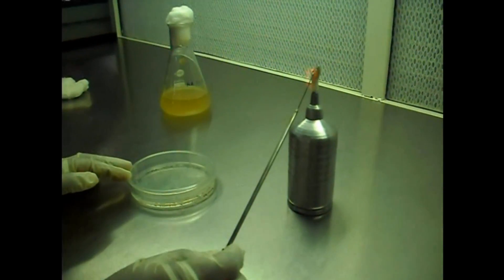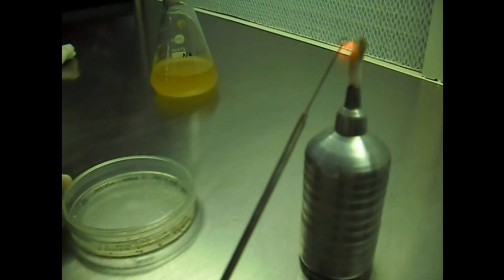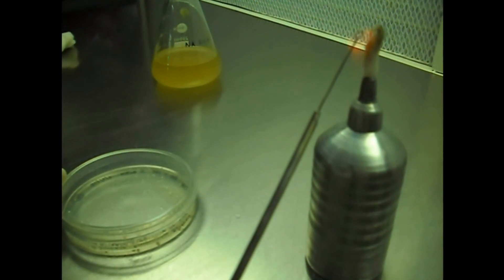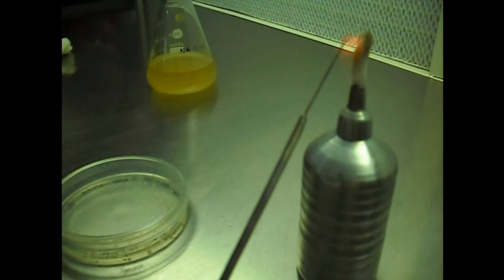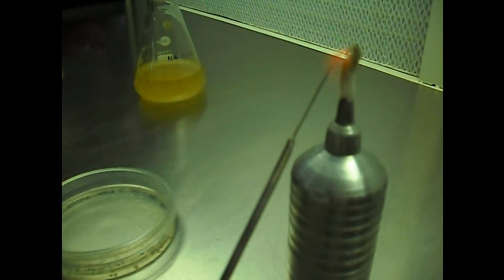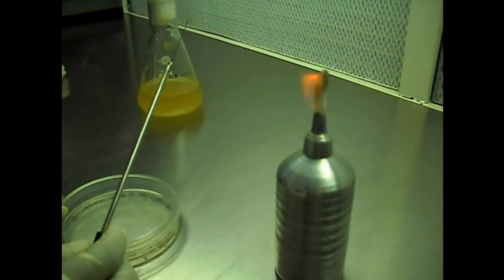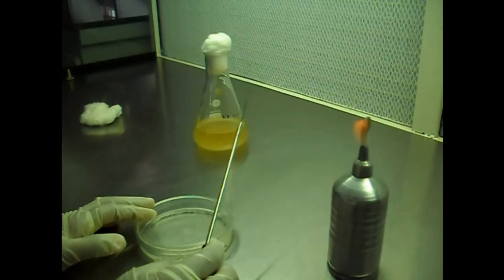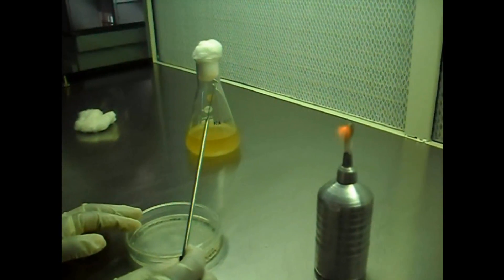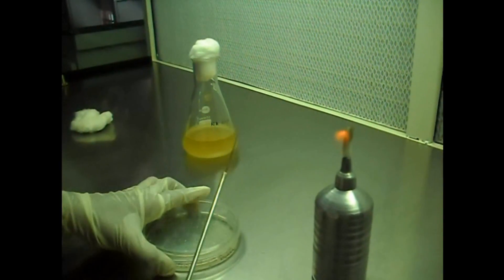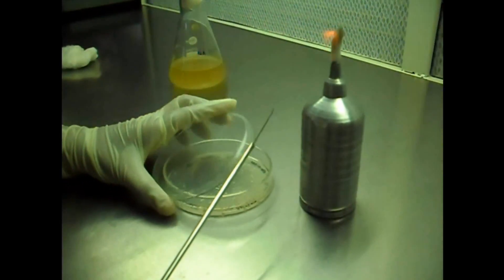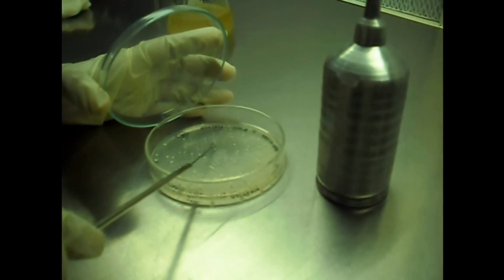Hold the inoculation loop. Open the bacterial culture and take a loop full of bacterial culture.